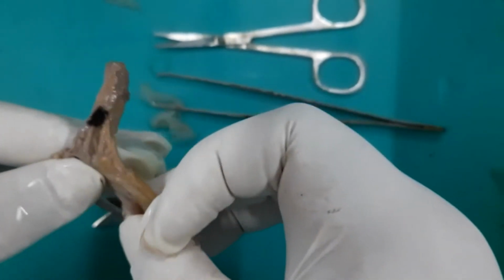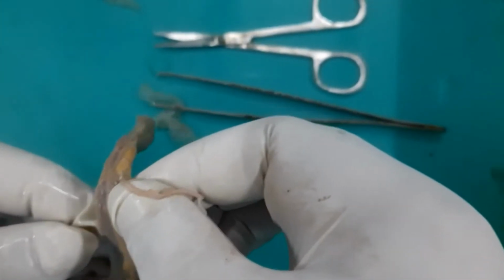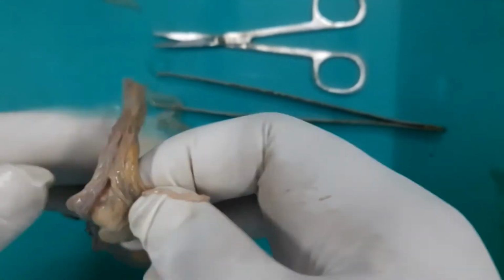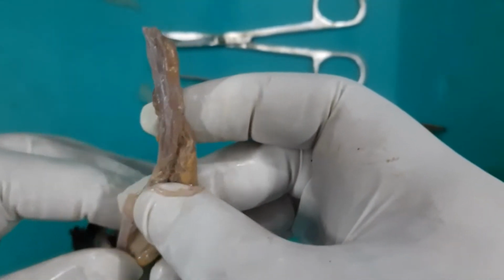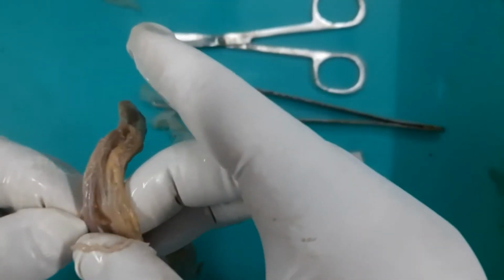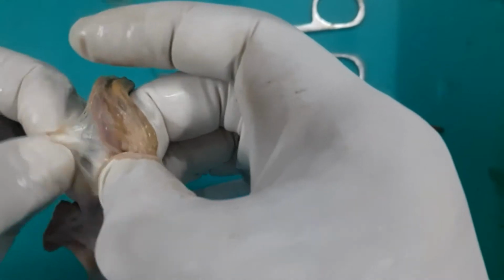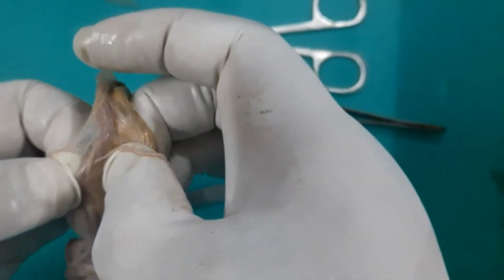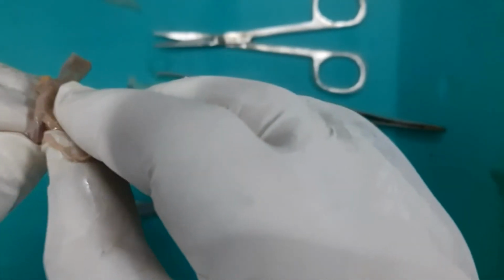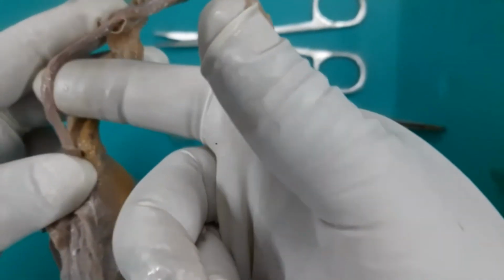Let us see now the contents of the spermatic cord, which in this testis is really difficult to show you because of the lot of adhesions. One has to feel these contents. You can feel a rubbery, muscular tube, and this muscular tube is the vas deferens or the ductus deferens. With the help of the finger, I am feeling and removing this ductus deferens, which carries the sperm right from the tail of the epididymis. See this, I have just dissected it out with blunt dissection.